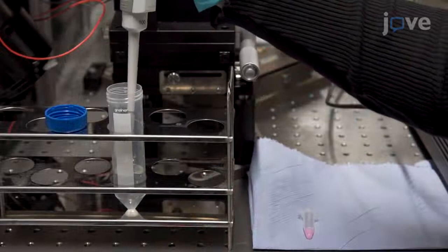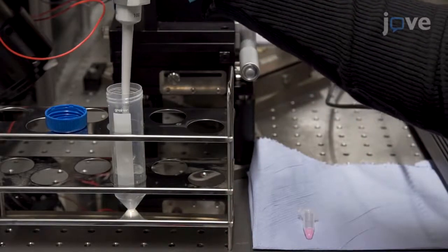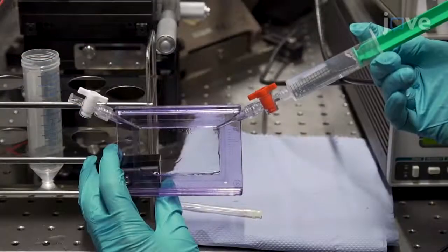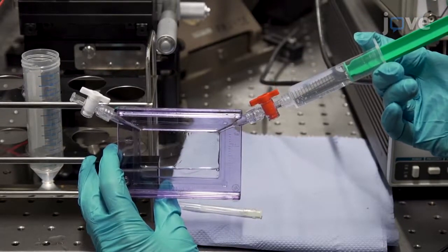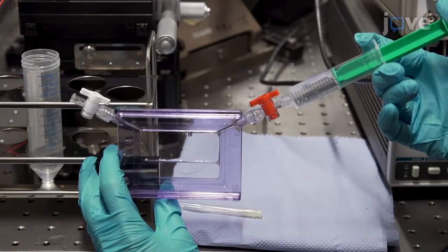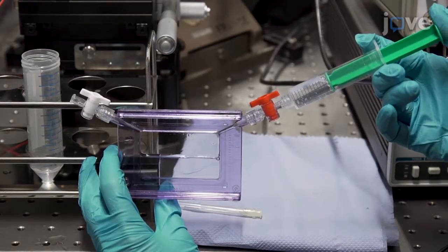Using a pipette, dilute the microbubble solution in filtered phosphate buffered saline. Use a 10-milliliter syringe to inject the sample into one outlet of the sample holder until the holder is full without creating air bubbles, injecting more sample if necessary.